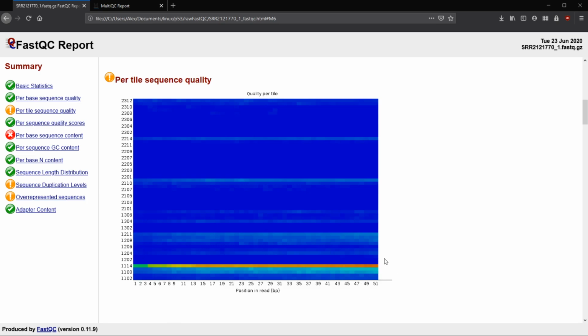This will only show up for Illumina sequencers that keep track of the location of the sequences that are being read on that chip. So it's not something that's always going to show up. The more red means the worse quality that base call was. So like we said here, the quality for base call 51, the last one of 1114, was more poor than good. And so the more red, the worse that quality was compared to the average of that column. So the average of all of these, the worse, the more red.